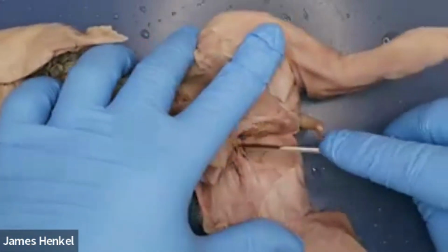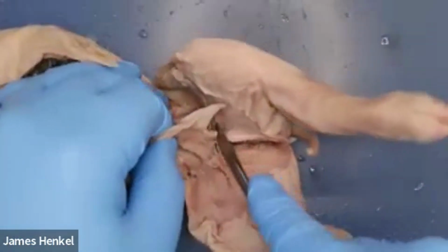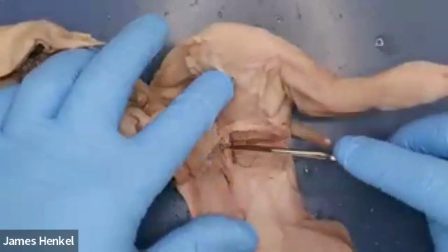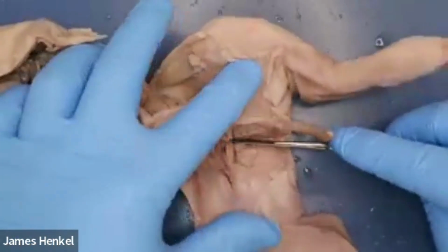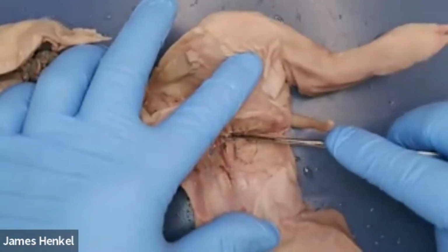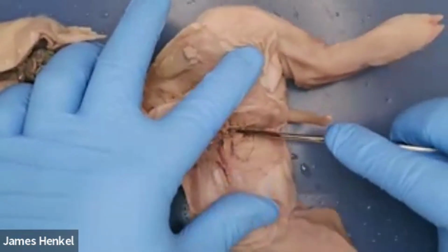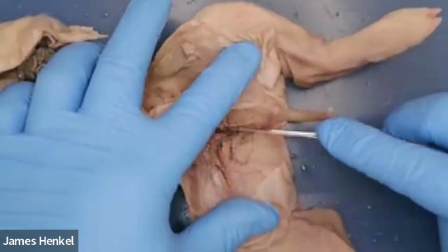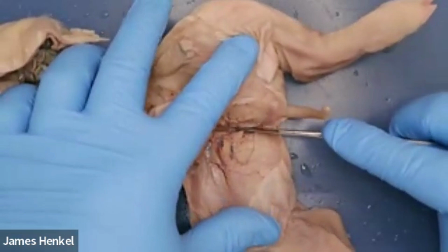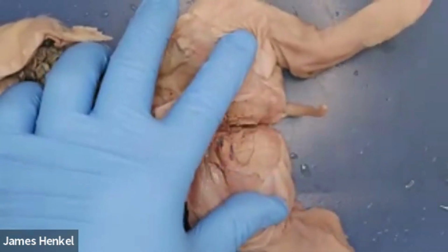You can see it splits out pretty easily, and the hips open up pretty well. And then we get to the pelvis. What we need to do with the pelvis is make sure there's a little bit more space. We'll have to draw the scalpel across this, and they're small enough bones at this point where you can take the scalpel and gently cut through it in the same place multiple times, and it'll just kind of open up like that. There's three bones that you really have to cut in the pelvis to open that up, and then all of a sudden it pops open like that.